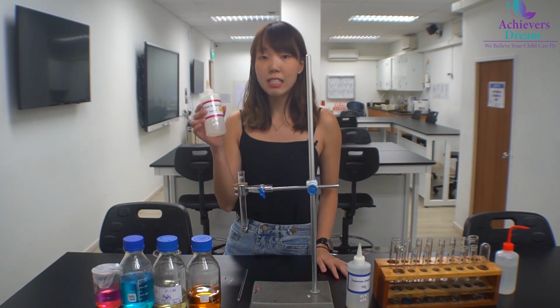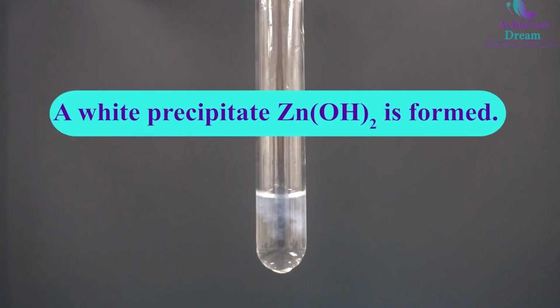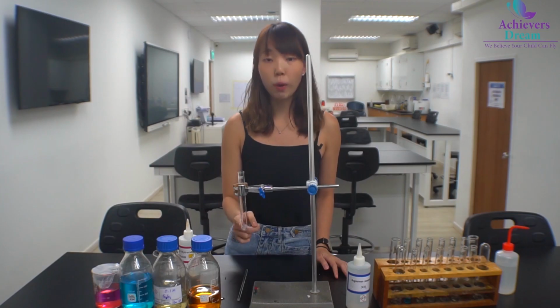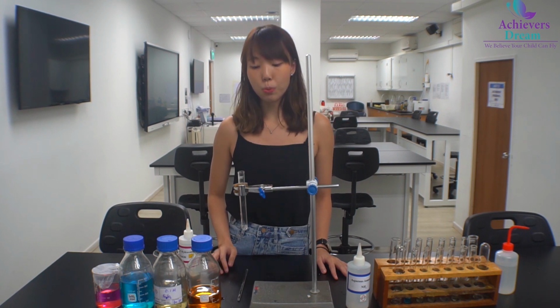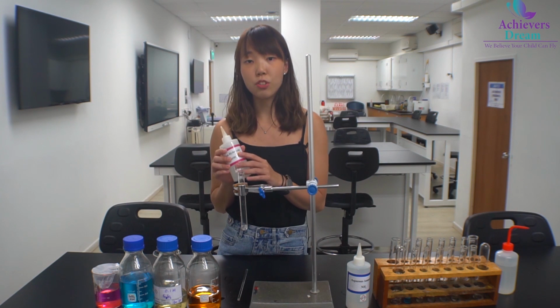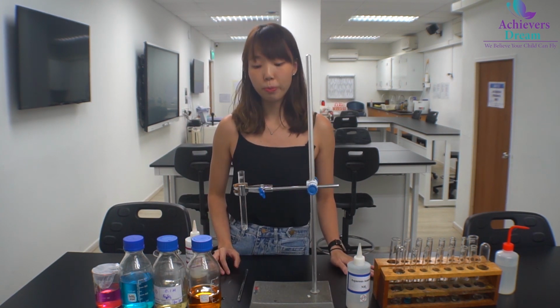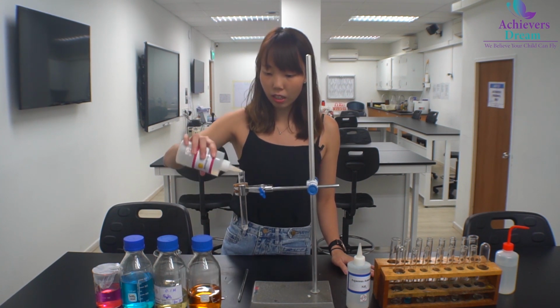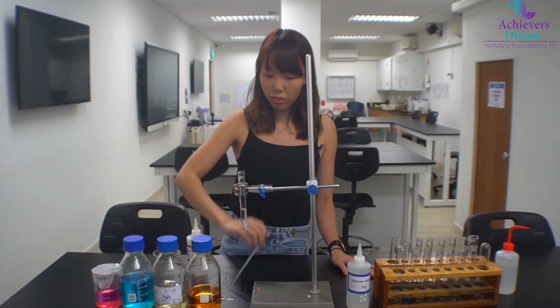So I'm going to be first adding in a few drops of sodium hydroxide. As you can see, there's formation of a white precipitate. This white precipitate is zinc hydroxide. So how is zinc hydroxide formed? It is when the zinc ions present in the unknown solution react with the hydroxide ions in NaOH to form Zn(OH)2.